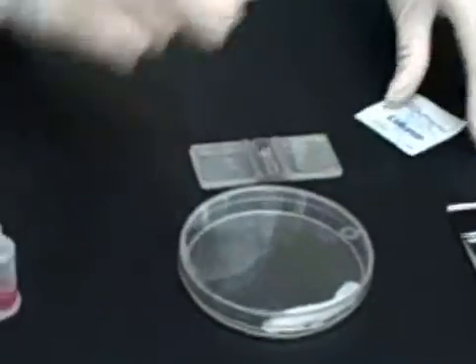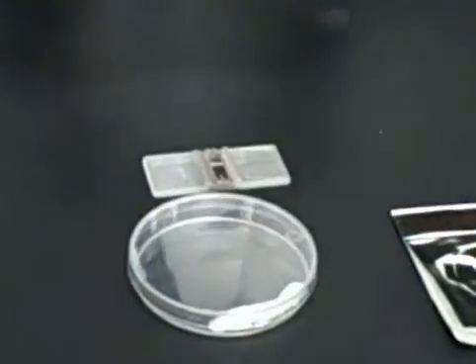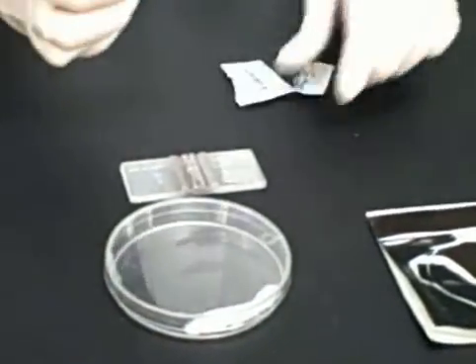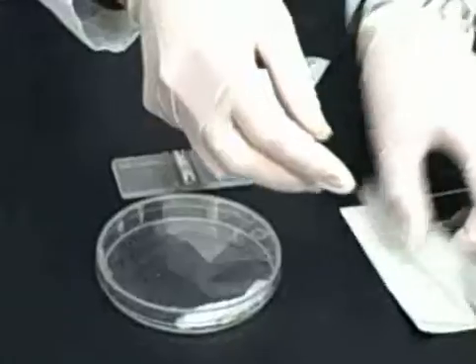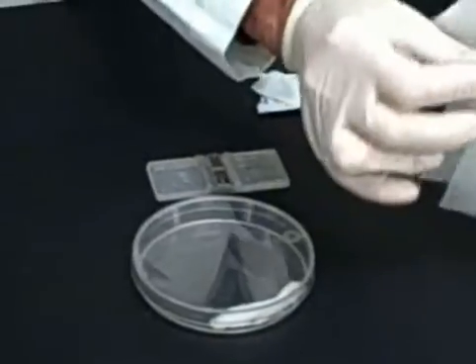You want to make sure you clean your hemocytometer well before loading it with your specimen. It's recommended to clean it with an alcohol prep and lens paper.